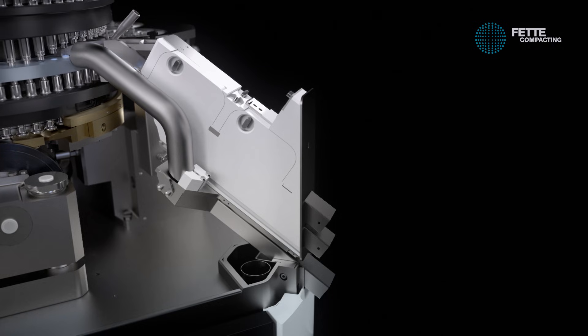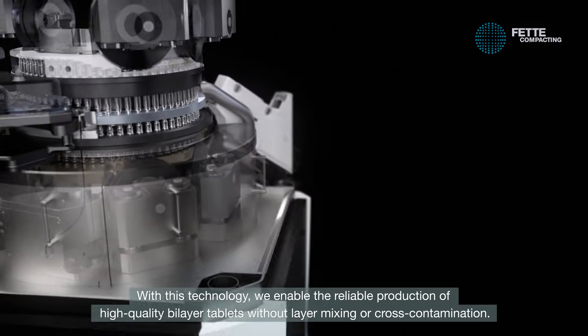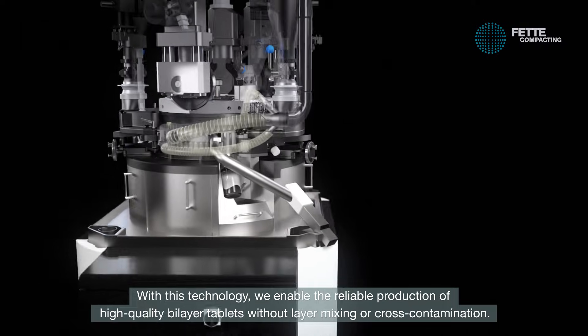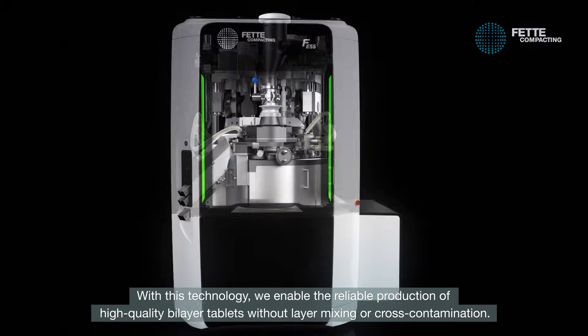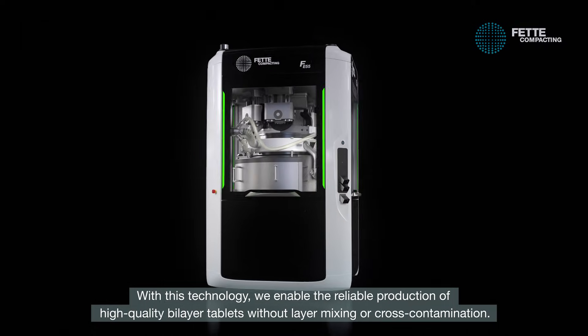With this technology, we enable the reliable production of high-quality bilayer tablets without layer mixing or cross-contamination.